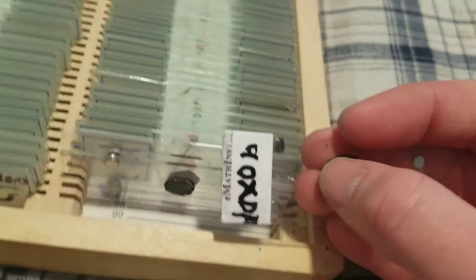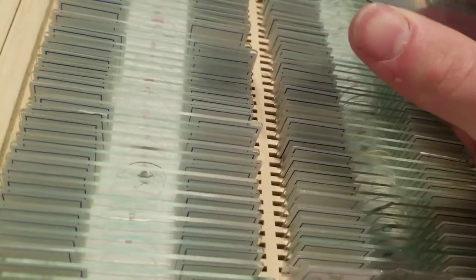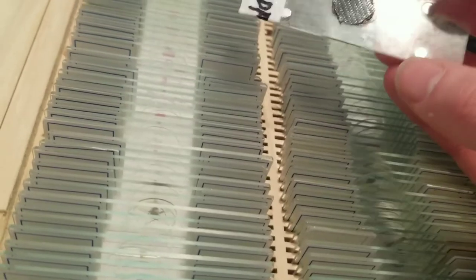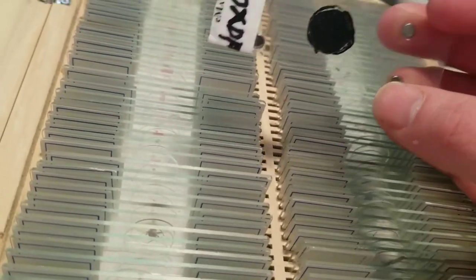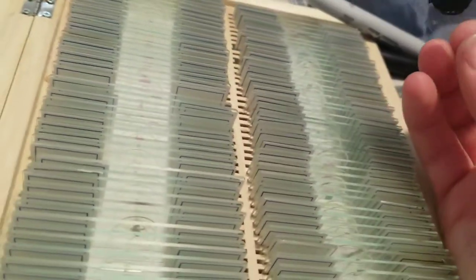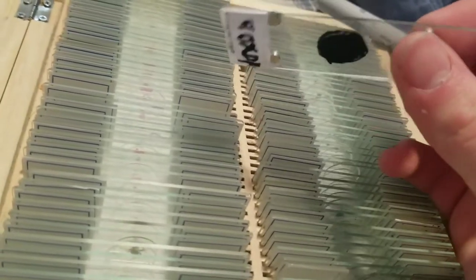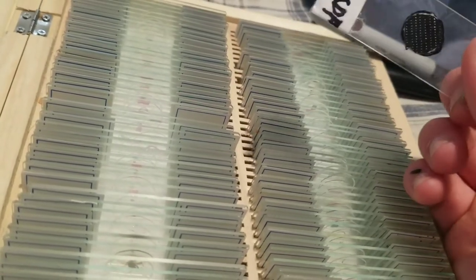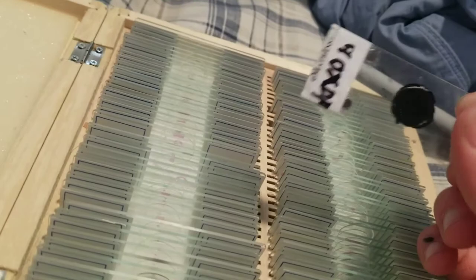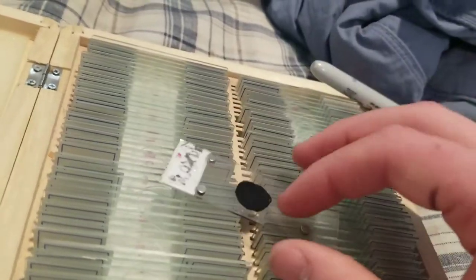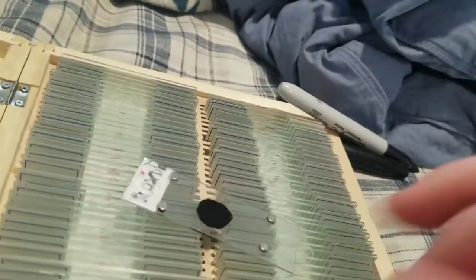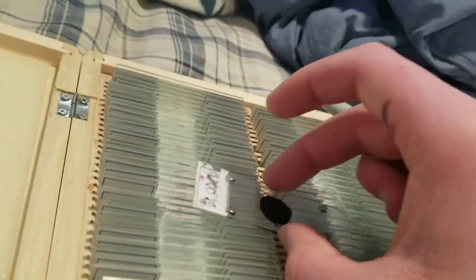40x dark field. So you might notice that this circle is bigger than the other two, and the reason is because with 40x magnification you get a lot of bleed. And what that means is light bleed, essentially, is the reason why it's more and more difficult to create dark field effects at higher magnifications, because the bleed of light, it all scatters and creates light bleed, so it looks more and more bright field.